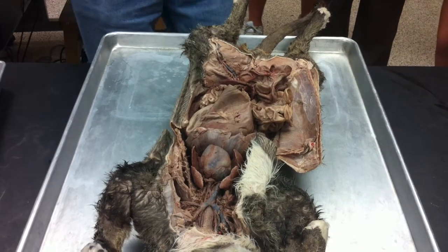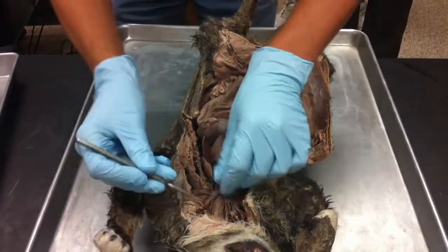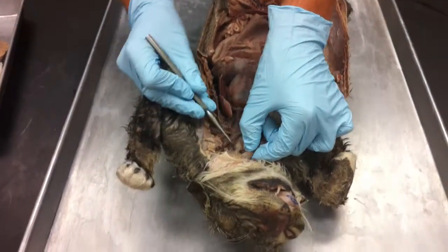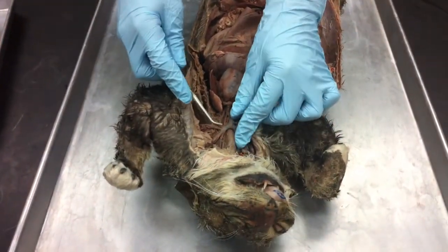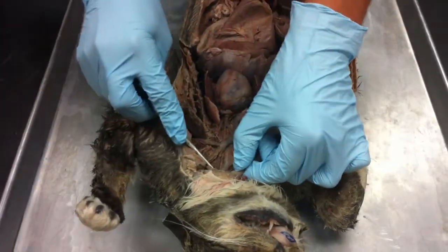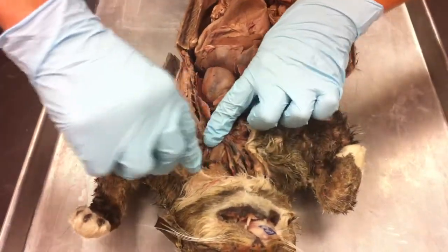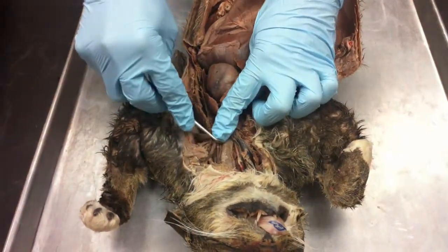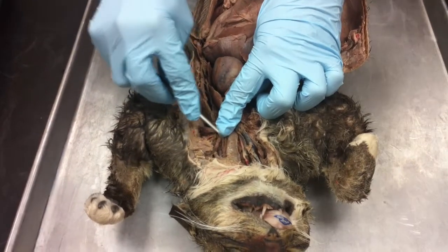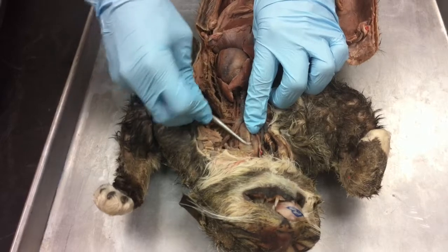So some of that stuff that's on that sheet we're going to identify in the diagrams, right? And so anyway, but we'll see a couple of the big things here. So right away, the esophagus is right behind the trachea. So let's see here. Okay, there it is. All right, so there's the trachea, right? You can see the rings of cartilage, right? That tracheal cartilage, it's hyaline cartilage, and behind it, this big tube right there, that's the esophagus.